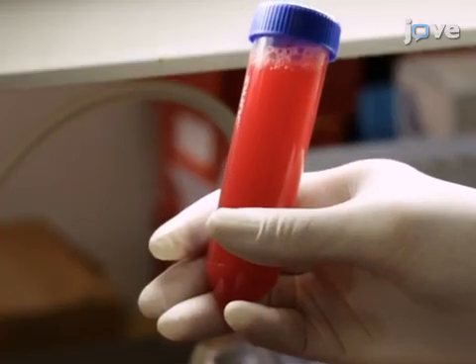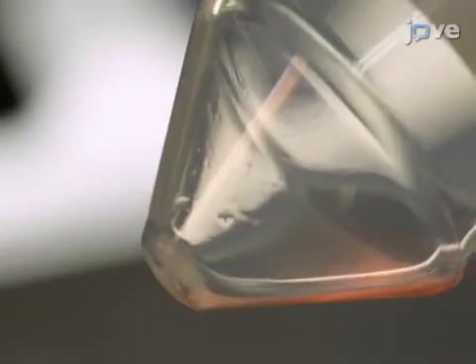When light can be observed through the tube, centrifuge the blood and confirm the presence of a white pellet.